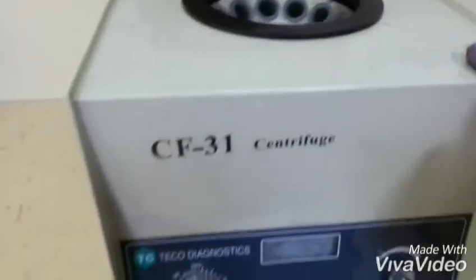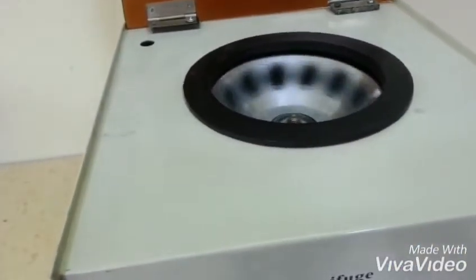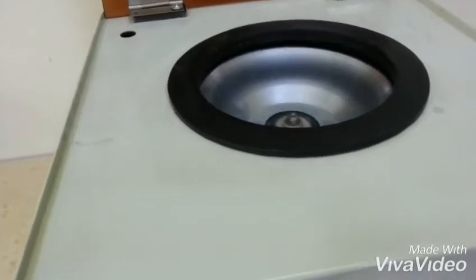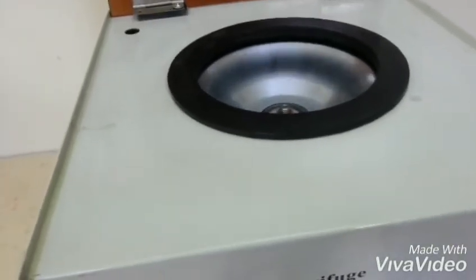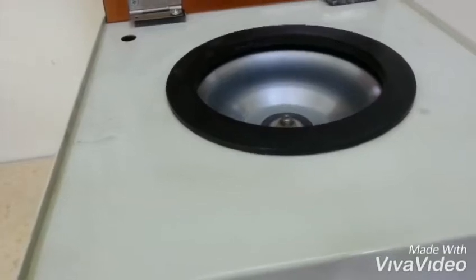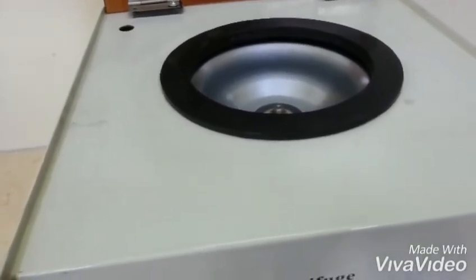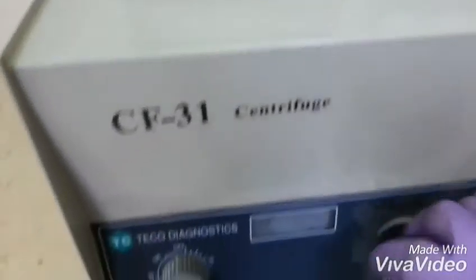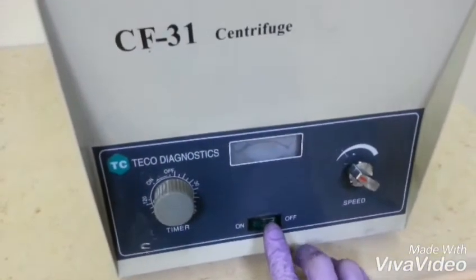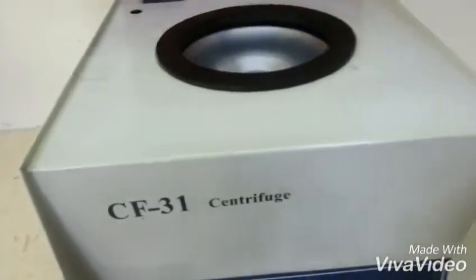The carbon brush — we will turn it on again. And then when you increase the speed. The machine is already functioning. Good job. Another machine already finished to fix.